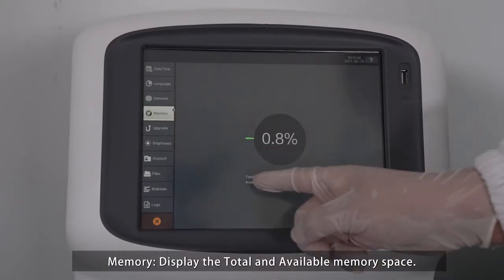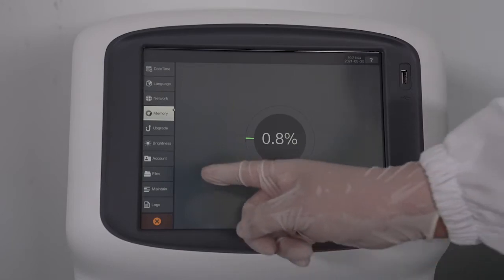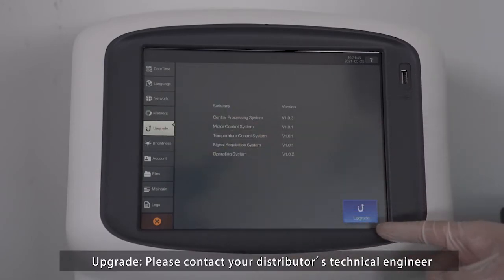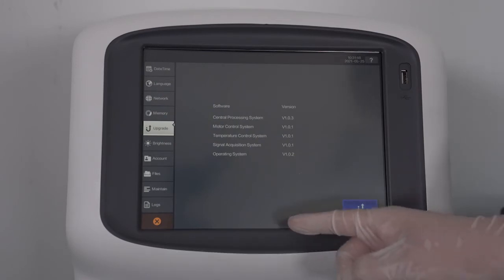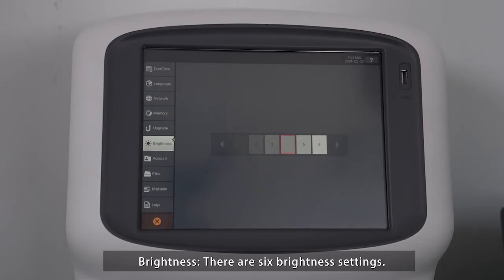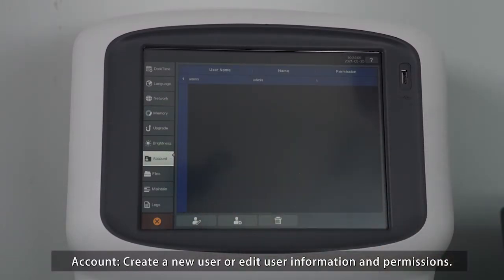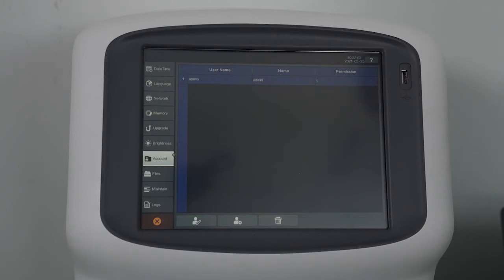Memory. Display the total and available memory space. Upgrade. Please contact your distributor's technical engineer regarding software upgrades. Brightness. There are 6 brightness settings. Account. Create a new user or edit user information and permissions.